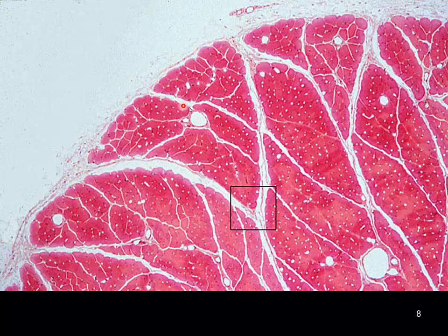Here we have one fascicle, but I'm never going to put the pointer here and say name this. If it's on the outside, I'm going to say epimysium. If I'm looking for perimysium, I will be between fascicles. And if I'm looking for endomysium that wraps each muscle cell, it's going to be a much higher magnification view, and it's going to be deep within one of these fascicles.